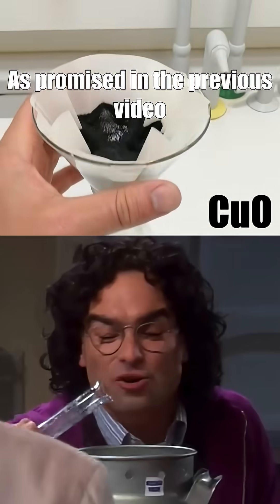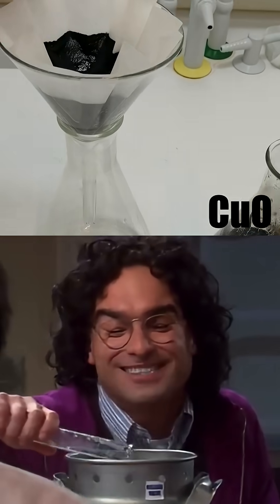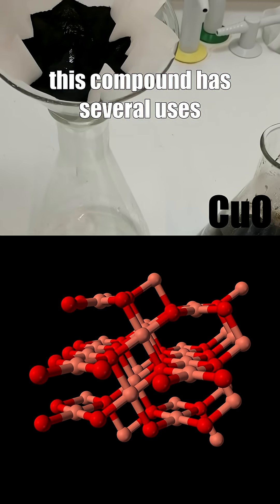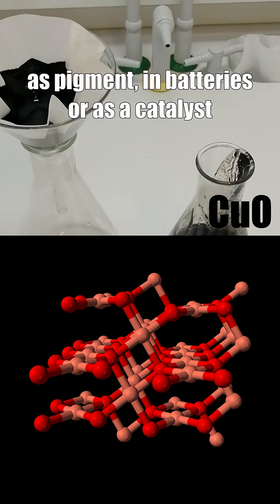Everything about copper, part 2. As promised in the previous video, I will show you how to synthesize cupric oxide. This compound has several uses as a pigment, in batteries, or as a catalyst.